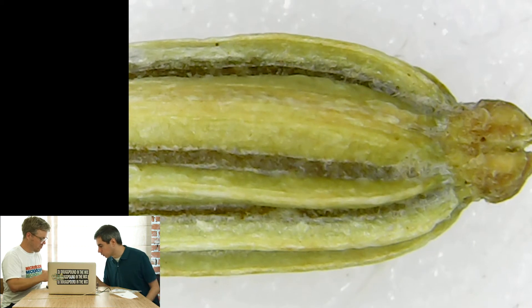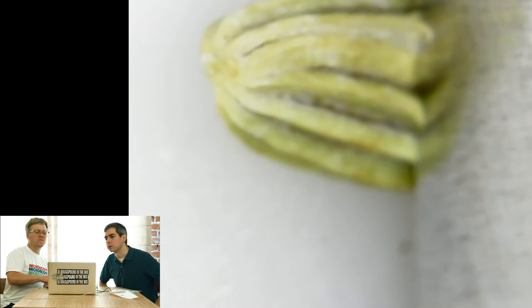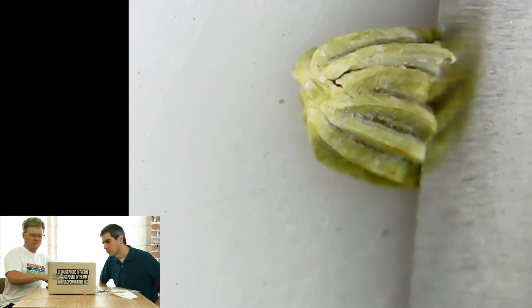I picked out two seeds here. One's a lighter one, one's a little furrier than the other. We're going to watch Doug cut this open. Do you need me to hold this? Can you do it yourself? Look at that — here comes a cut. It's cutting open the fennel seed. There it is. Oh! It flew away.